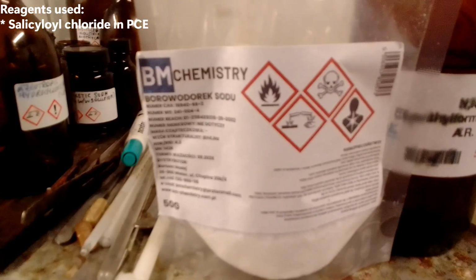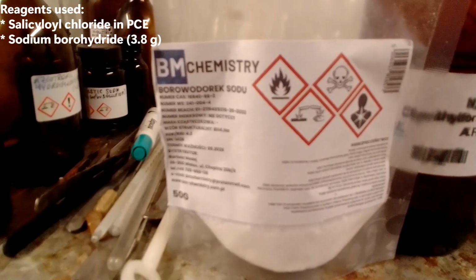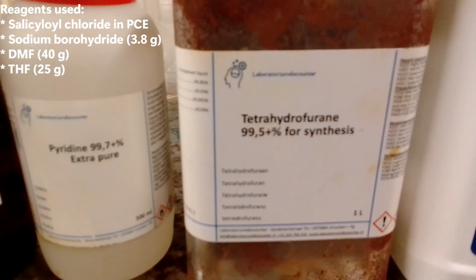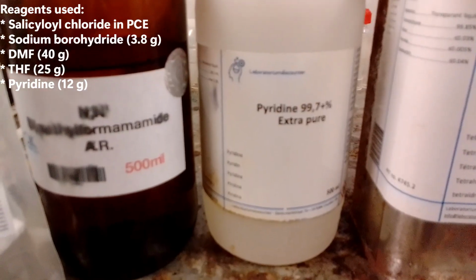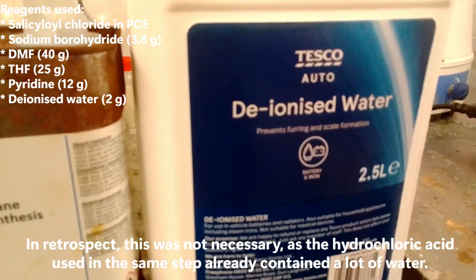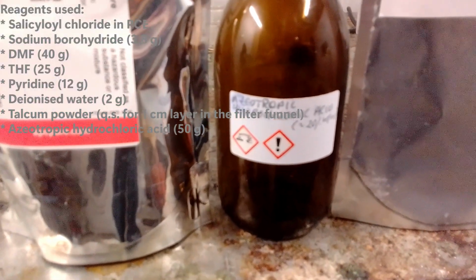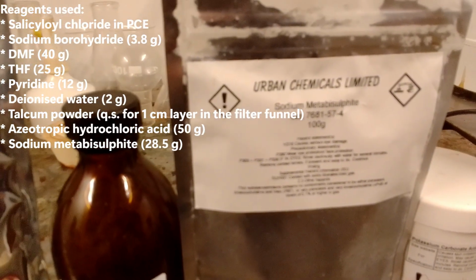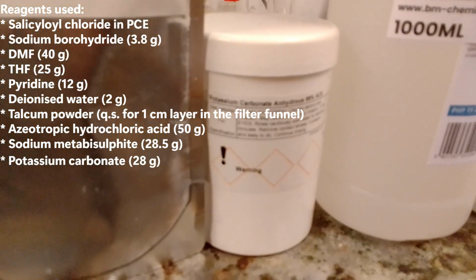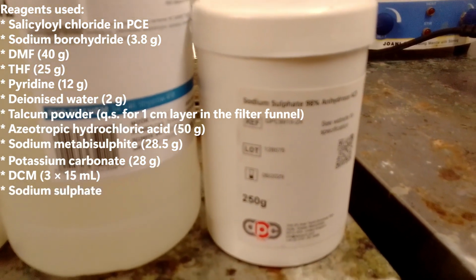The reagents used were salicyloyl chloride solution in perchloroethylene, sodium borohydride 3.8 grams, DMF 40 grams, THF 25 grams, pyridine 12 grams, deionized water 2 grams, talcum powder, 20% hydrochloric acid 50 grams, sodium metabisulfite 28.5 grams, potassium carbonate 28 grams, DCM 3 portions of 15 ml, and sodium sulfate.